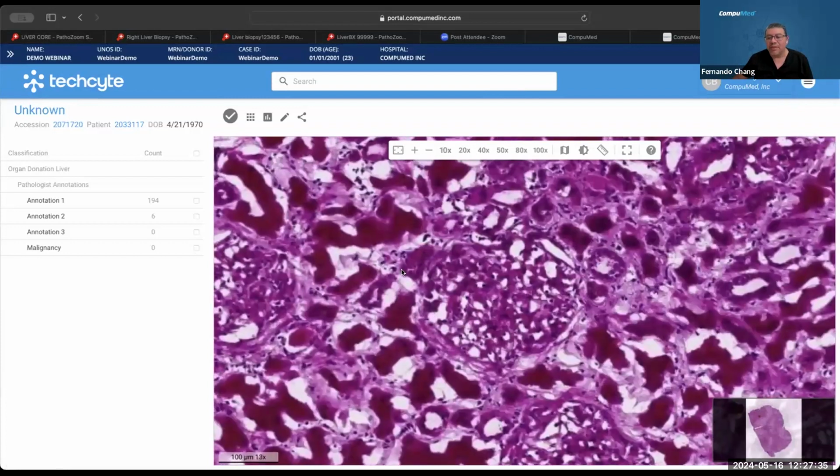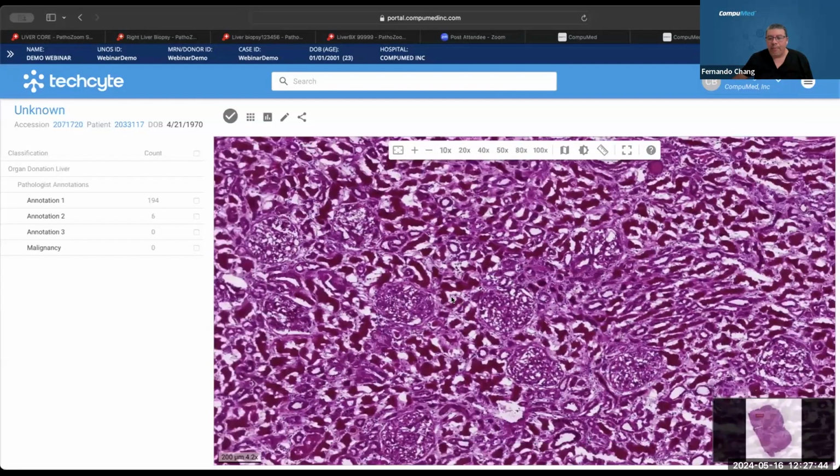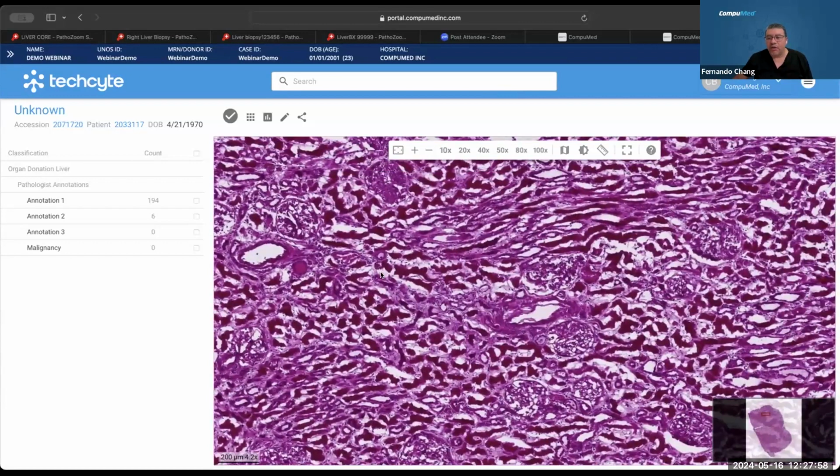And you can see how busy it looks because it's a superposition of cells, and that's why it happened. And this most likely is because it was cut too hot. It was not cold enough, and you can see that. And we can see the compression artifact all over the place as well.